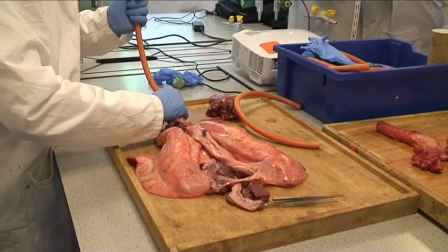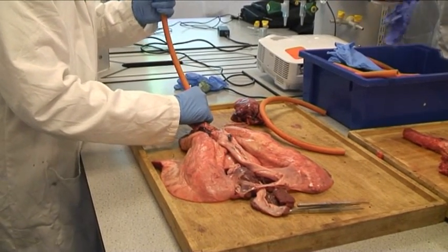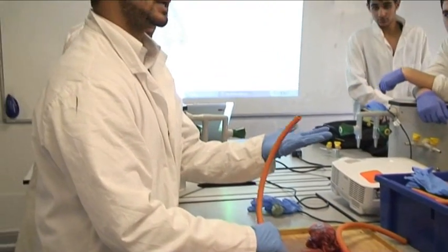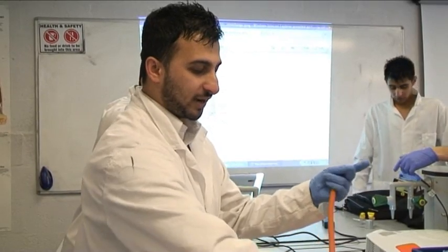Anybody want to go at this after me? Right, okay, just watch it first of all, please, guys. Important health and safety — when you're doing it, guys, what I normally tell students is: get a clean glove, put your hand over it here like this, so you're not really touching the mouth bit here.